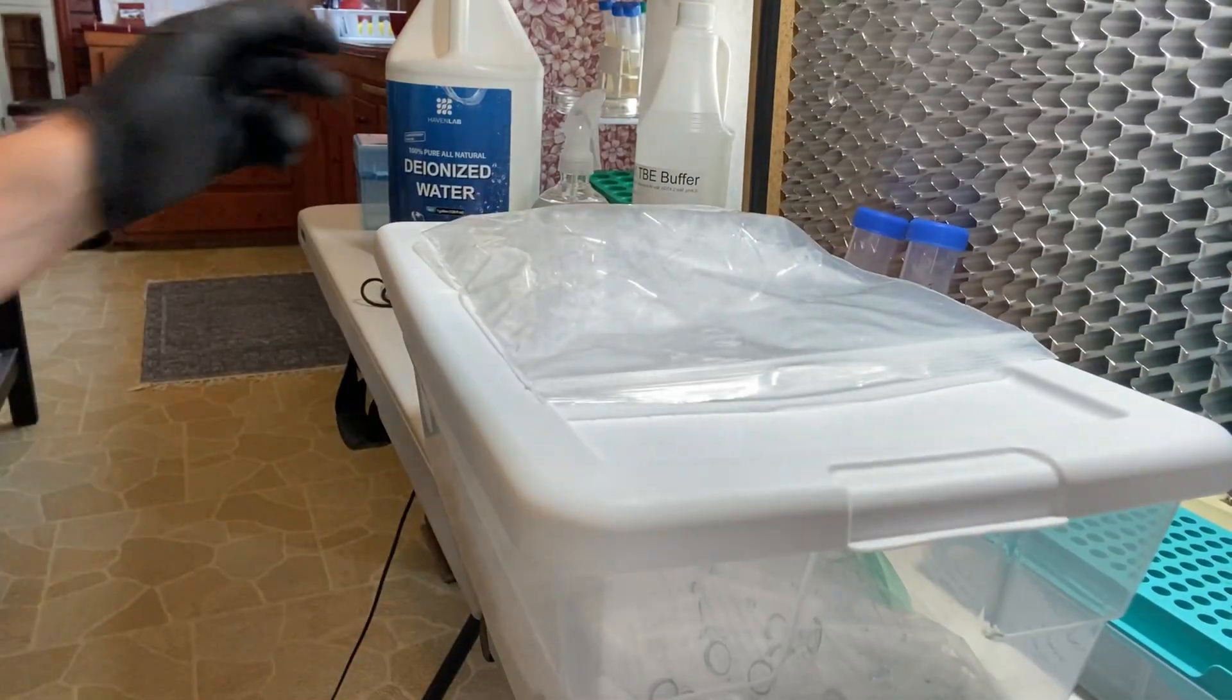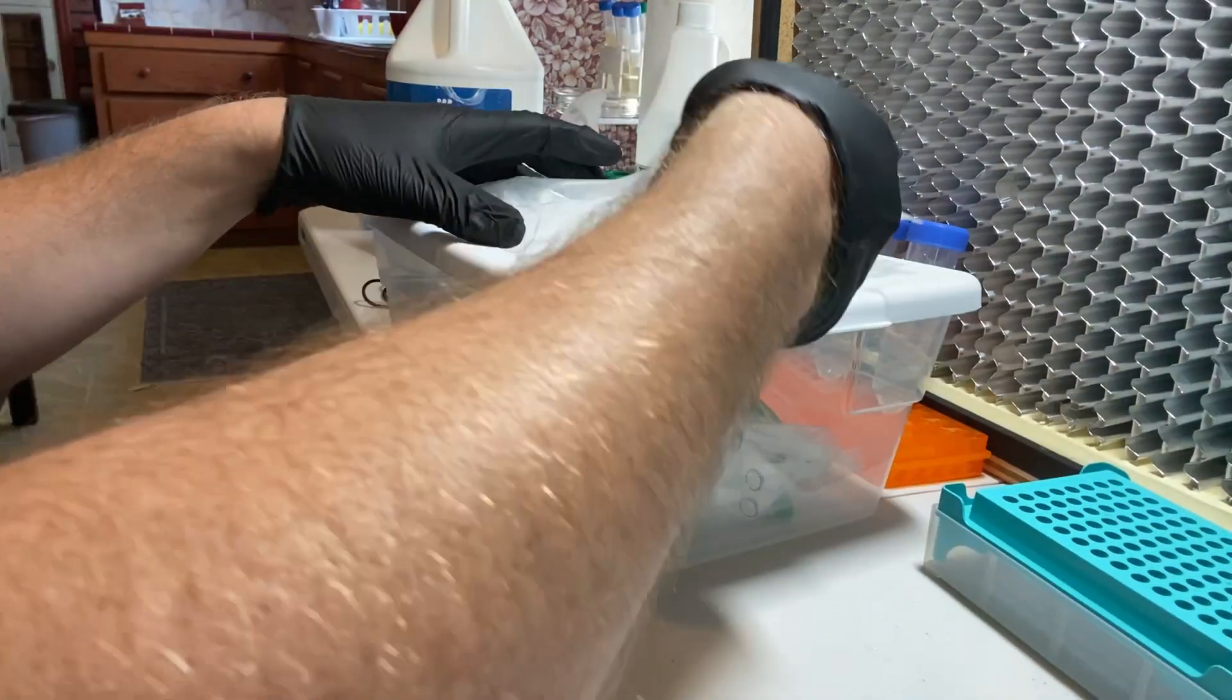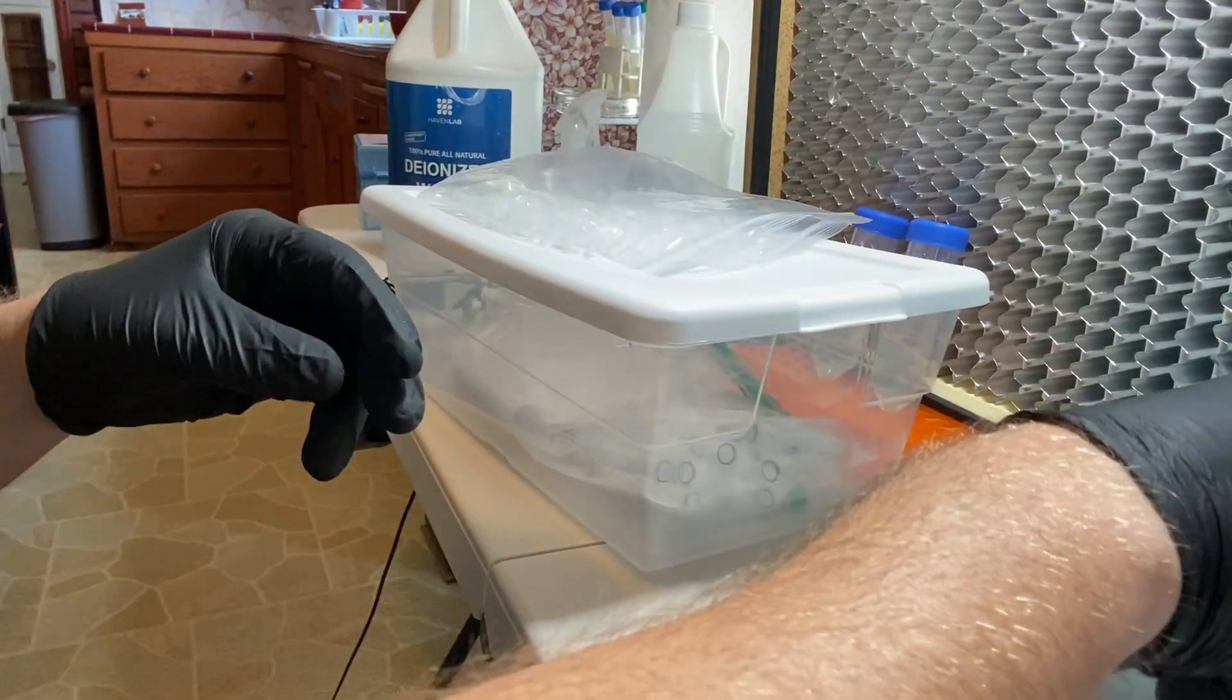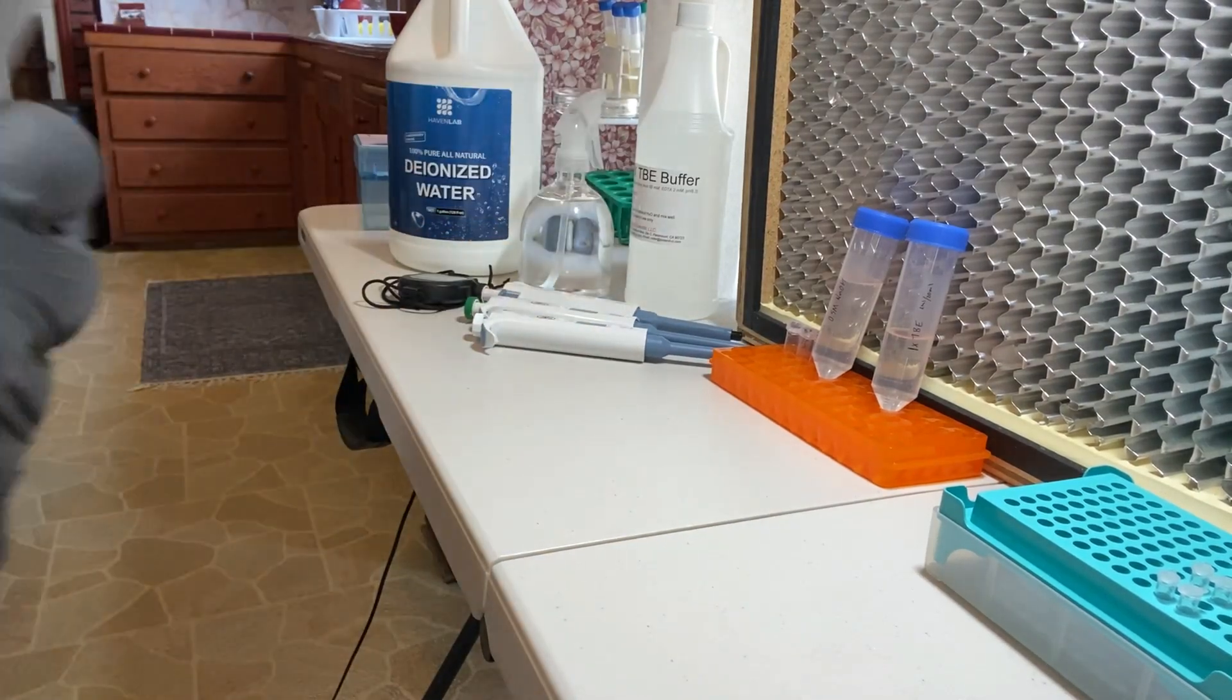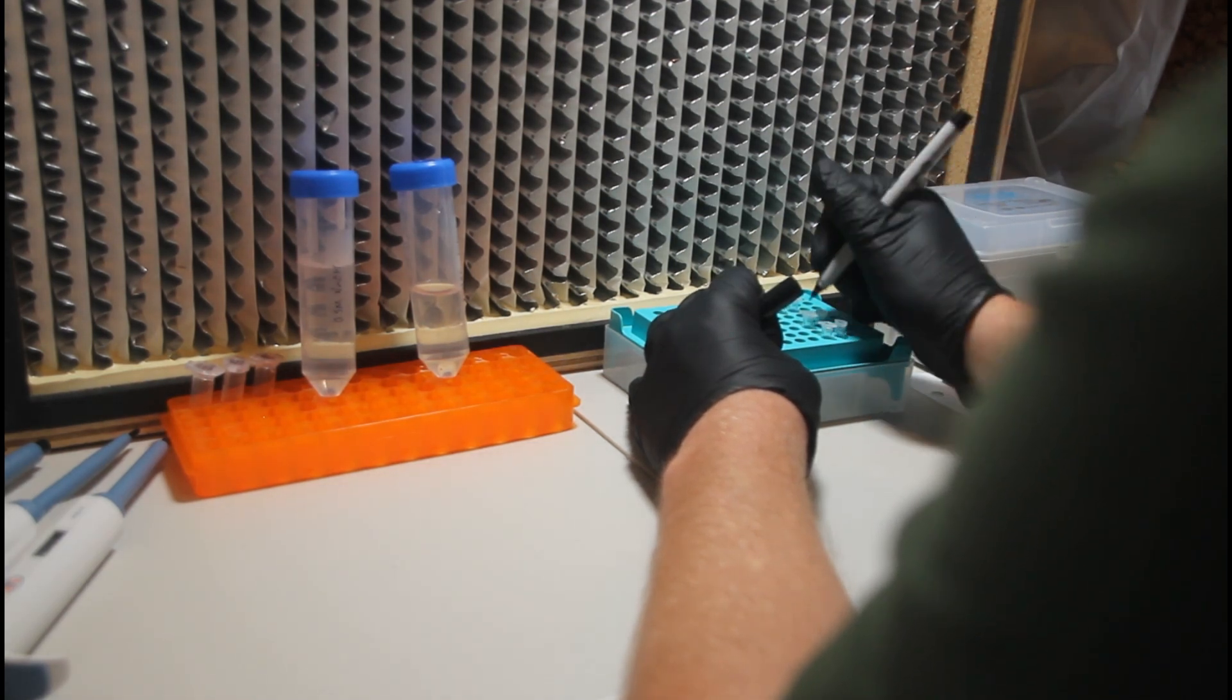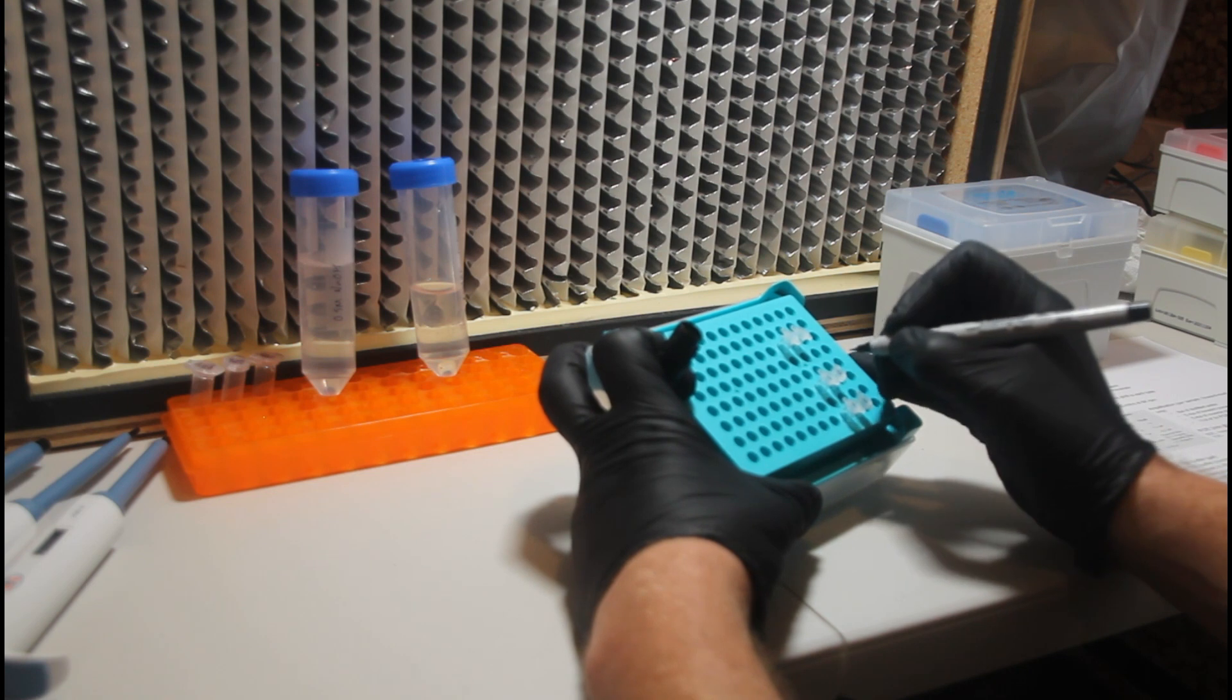And then we'll need one tube for the PCR reaction. And then later on you're going to need an additional set of tubes to send the PCR product to the lab for sequencing. But for now you can pull out two tubes per sample. I like to label them 1A, 2A for the DNA extraction or template DNA tubes. And then 1B, 2B for the PCR product. This just helps me to keep track of which tubes are which.